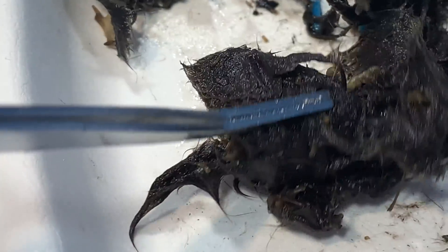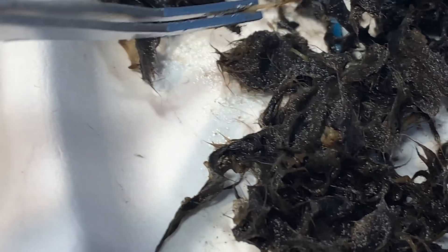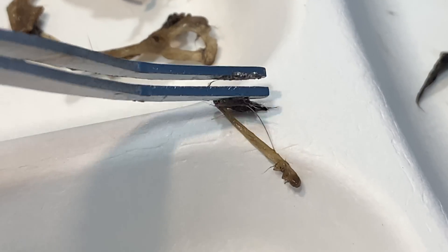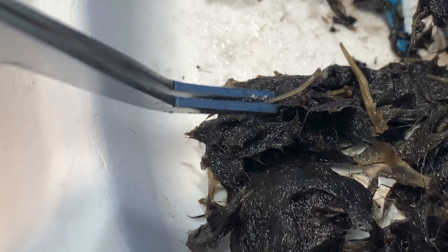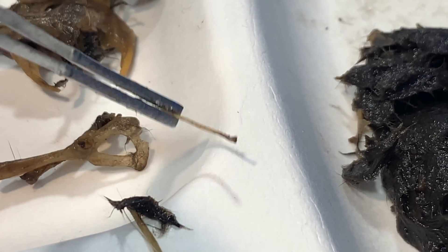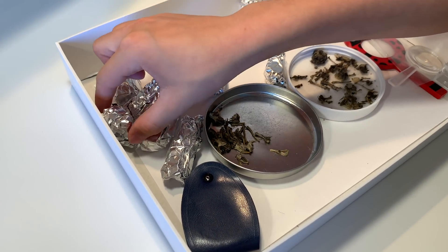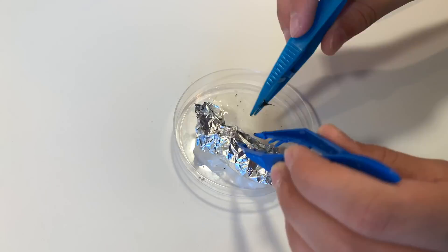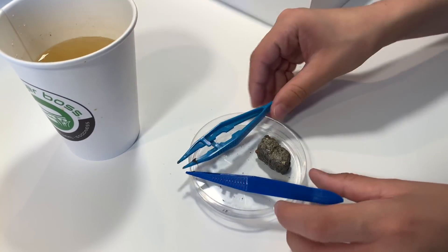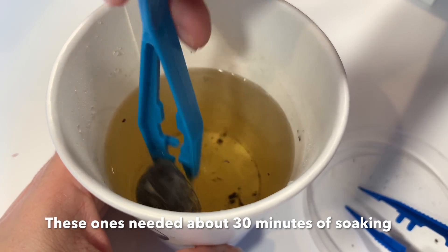We're going to keep going through this owl pellet — this one turned out to be the most fruitful of all the owl pellets. There were so many bones; in fact there were three skulls, which we did not find in any of the other owl pellets. My son is going to pick one of the owl pellets we previously baked — they're nice and cool now, however they are really hard. It's possible that I over-baked them or left them in the oven too long.